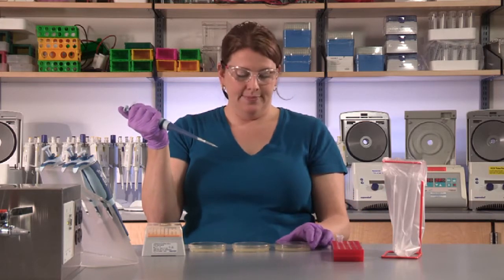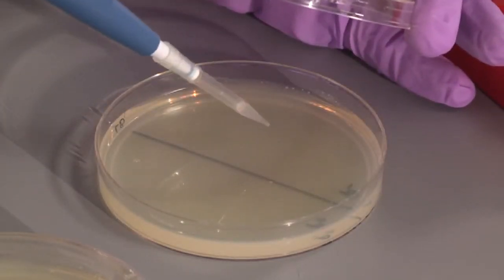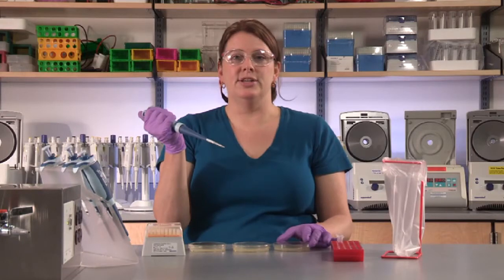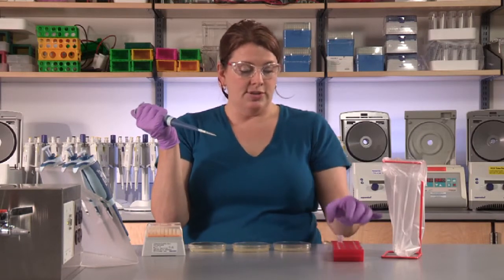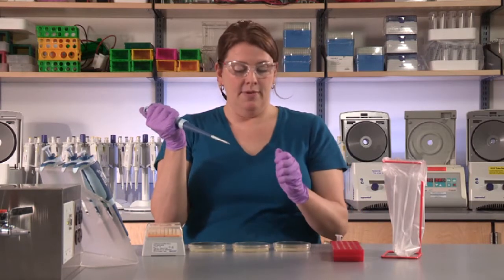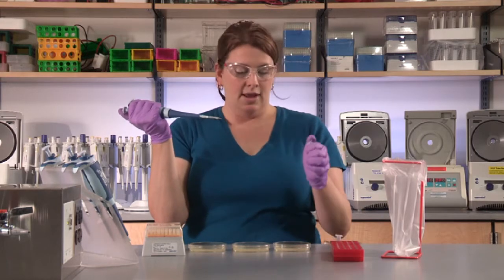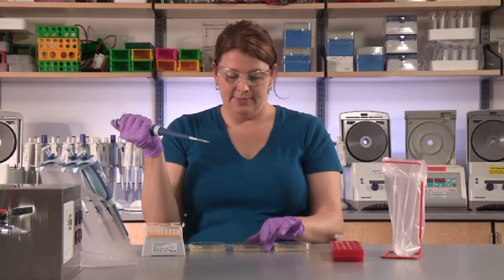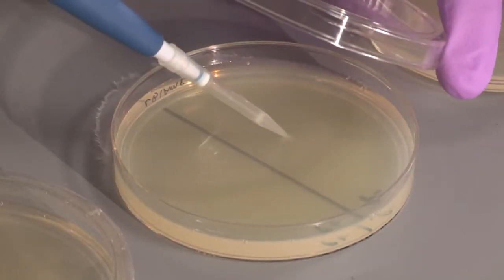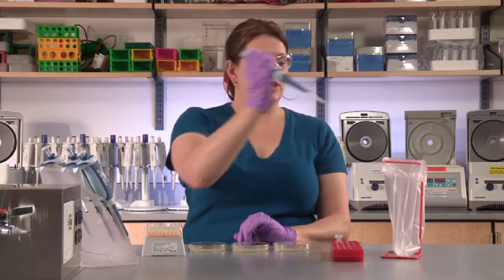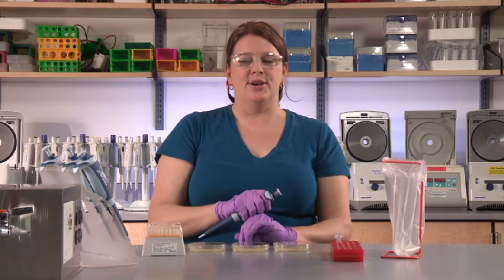Open your first plate and very gently to the side add the P- cells, then close the lid to avoid contamination. You can use the same tip to again draw up 50 microliters of the P- cells and add them to the second plate. At this point, you can eject the tip and you're ready to spread the cells.